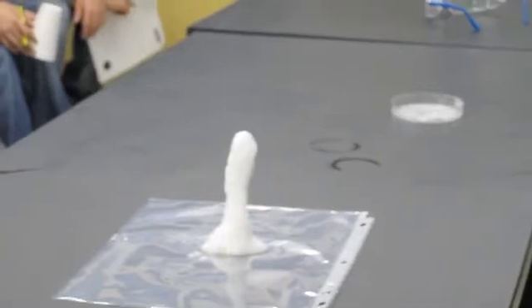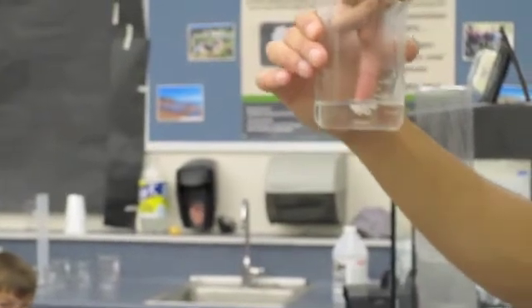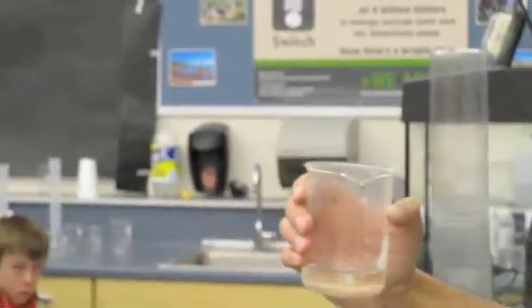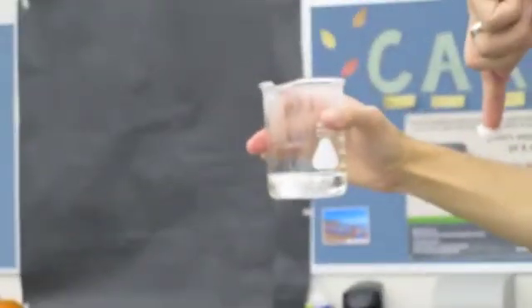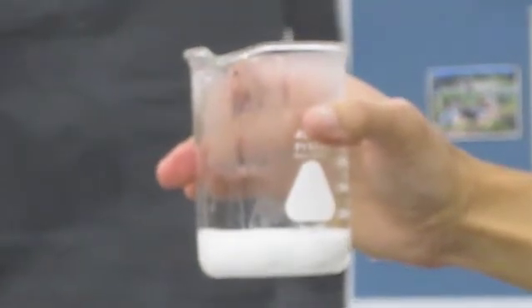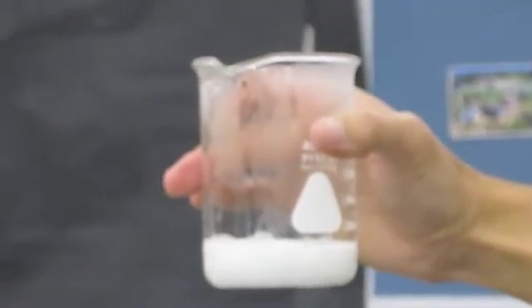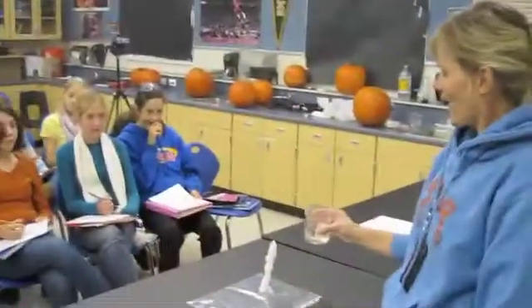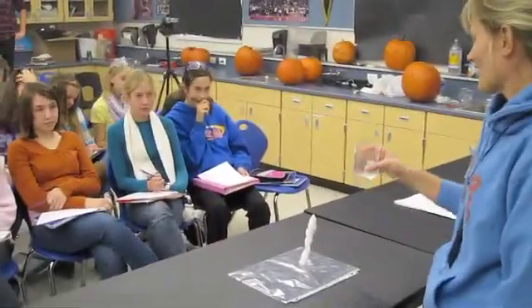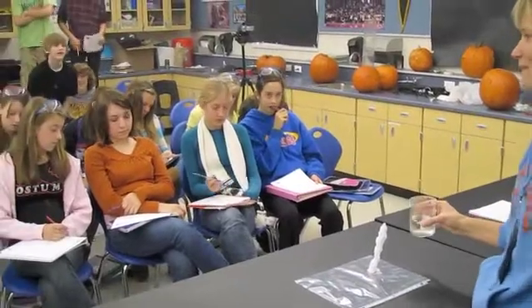And if you can imagine, we're providing a solid crystal. Actually, I might even try this with my hand. I'm just going to touch with my finger, which gives it a solid seed to bond to. And what you'll see start to happen, look at my finger now, and now look inside the beaker. Instantly, it's going to turn all of this stuff solid because it's a supersaturated solution. What I'm going to do now is I'm going to actually let this touch the beaker. Anyone want to predict what's going to happen?